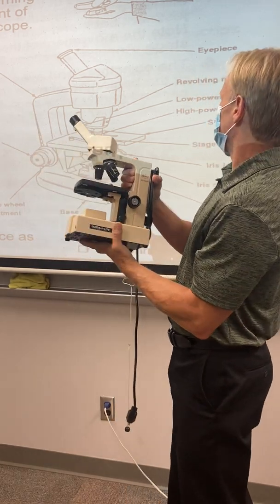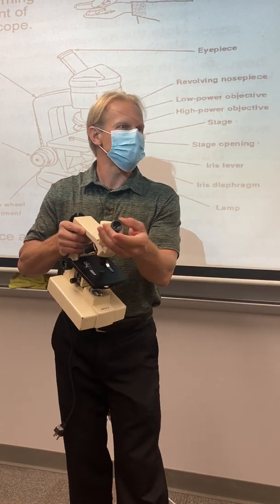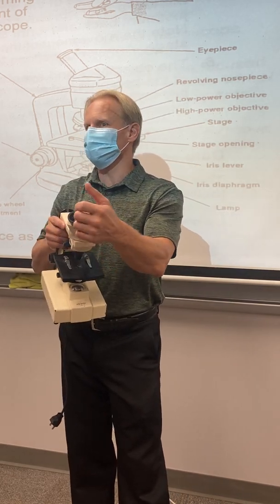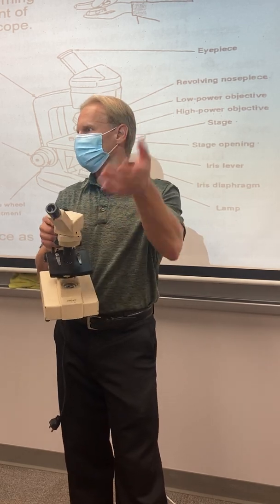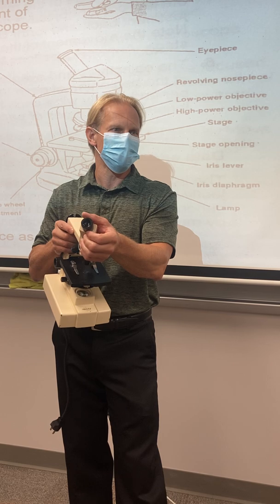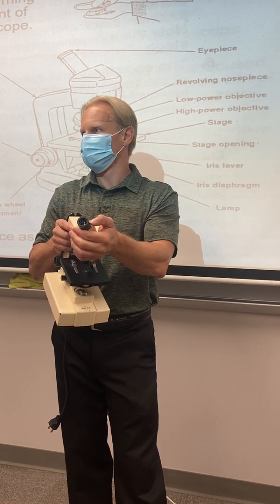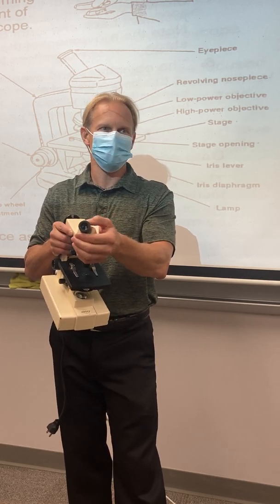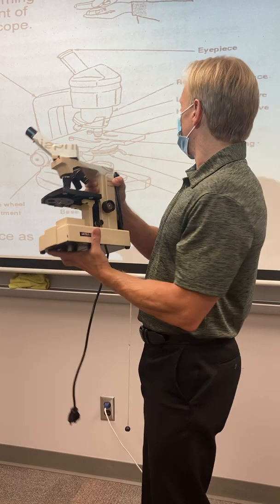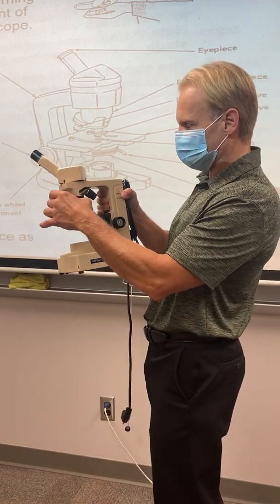So we also have the eyepiece, which is up top here. It spins, it won't come off, but it spins because there's a little arrow in there that you can actually turn to point to something. So if you're like, hey, Hambling, I need some help with this, what is this thing I'm looking at? You could turn this to point your arrow at it, and then we know what we're talking about. Some of them actually have a little scale in there to help you measure, but we won't do much measurement with these. We have the revolving nose piece, which is this piece right here.